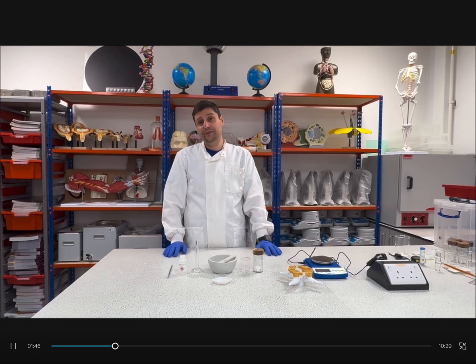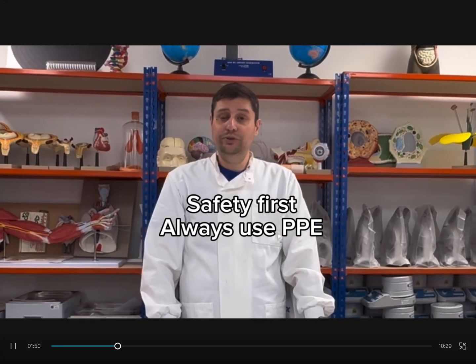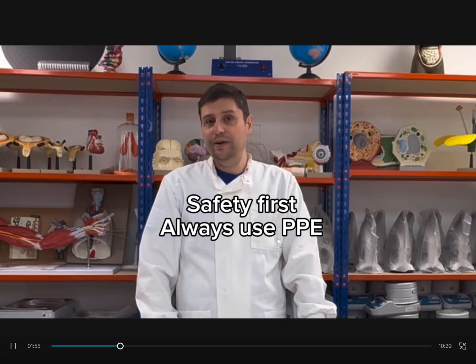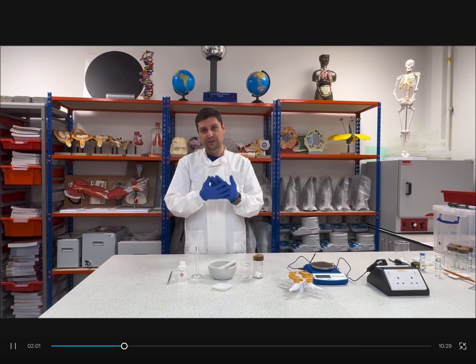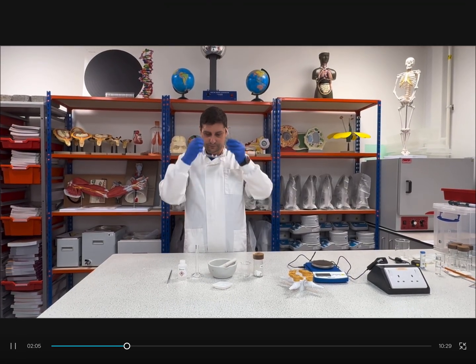So the first thing first, safety. Okay, so although none of the chemicals we are using are very hazardous, we always need to protect ourselves with PPE. For this practical, a lab coat is important, gloves, and specs.